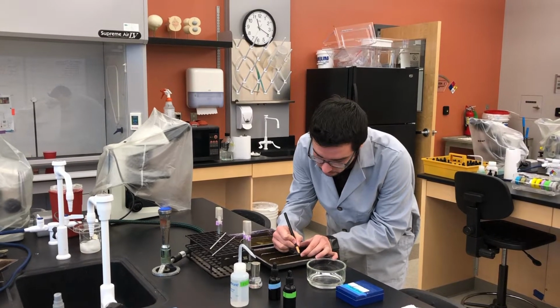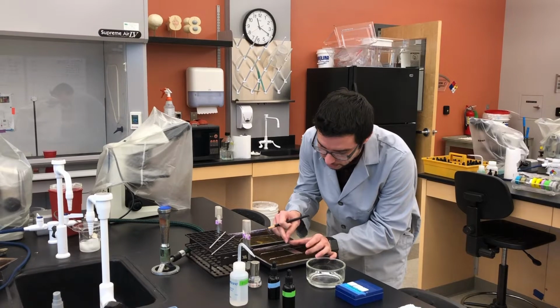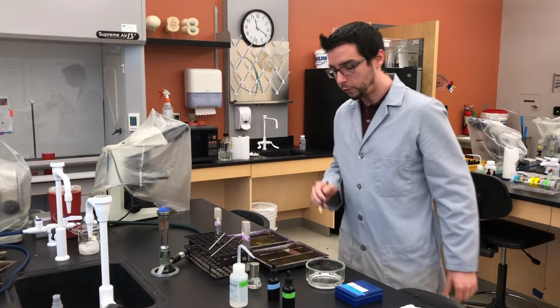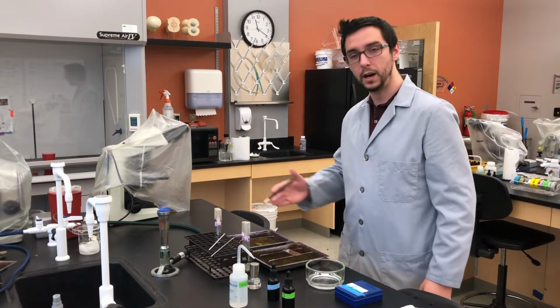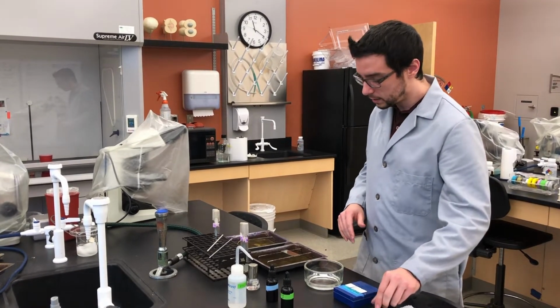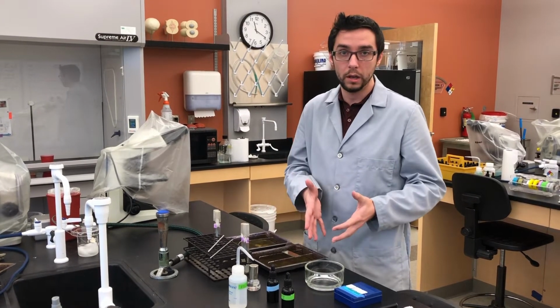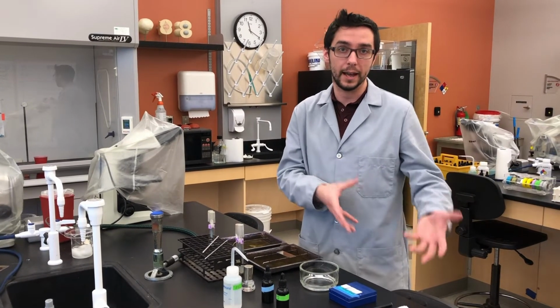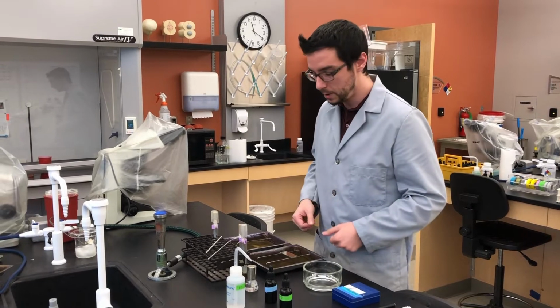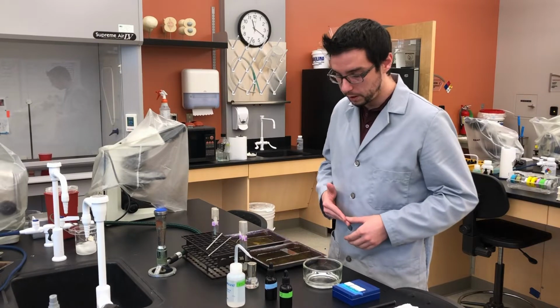Now, what I'm doing is I'm labeling each side of the slide uniquely for which culture I'm going to be smearing on that respective side of the slide. The reason for that is we're putting both smears here, so you don't want to mix up which smear contains the bacteria that has the potential endospores. Okay? So get them both labeled very clearly so you know what you're working with.